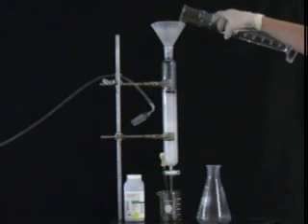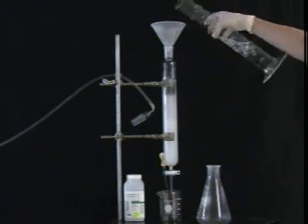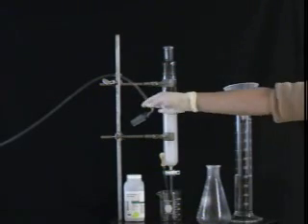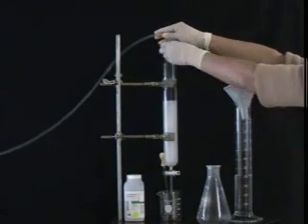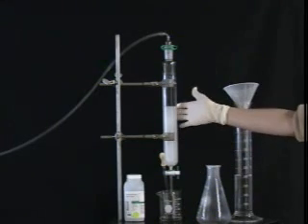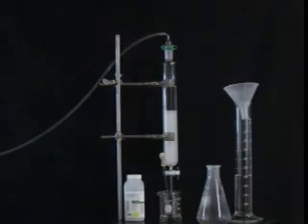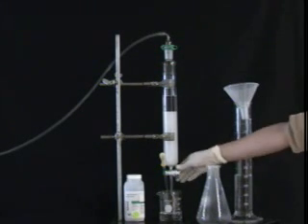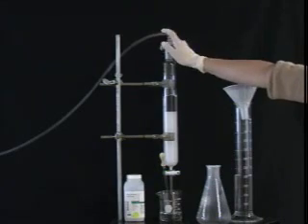Use additional solvent to add the remaining silica. Once you have added all of the silica, rinse the funnel and sides of the column with a small amount of solvent. Apply pressure to the top of the column and open the stopcock, tapping the sides of the column gently to make sure that the silica layer is flat. Drain the solvent until 2 or 3 inches remain above the silica layer. Then close the stopcock and remove the pressure.